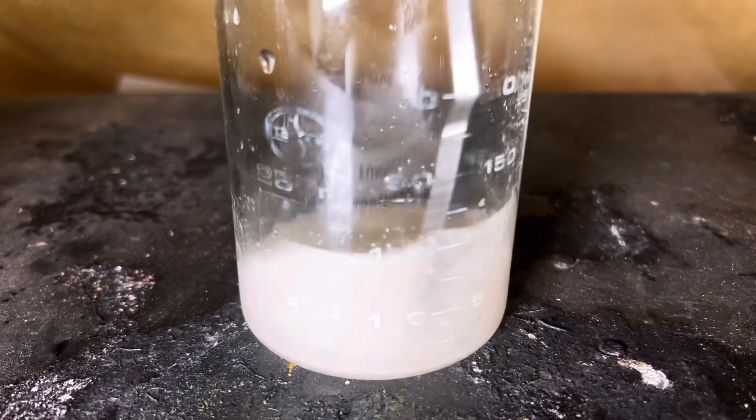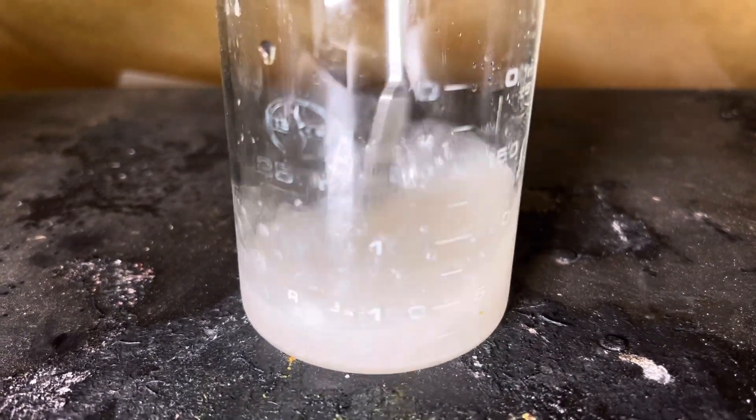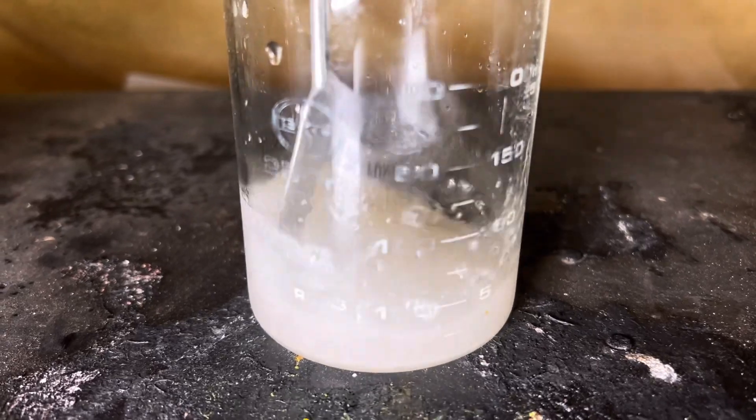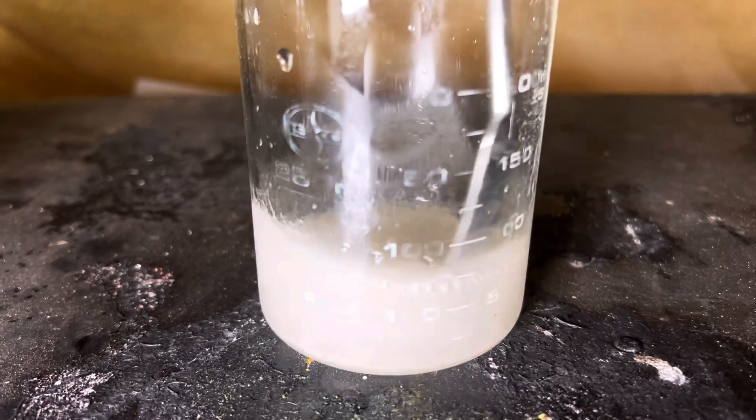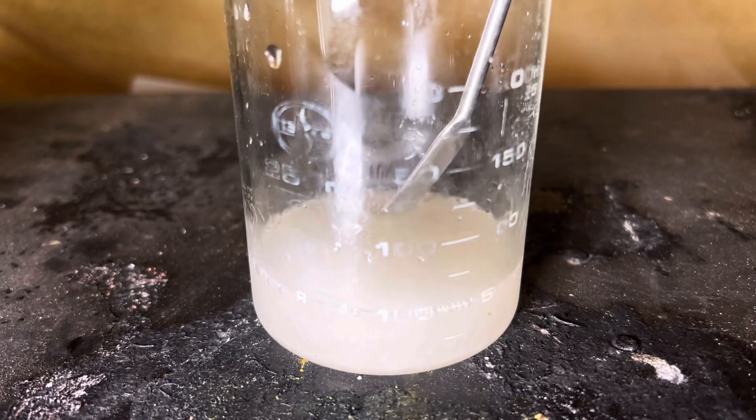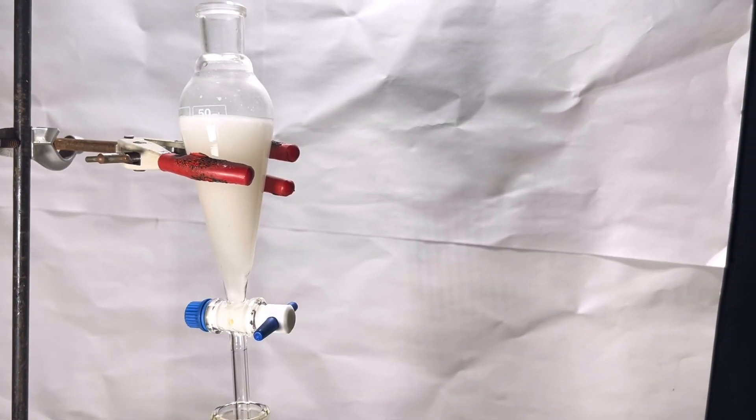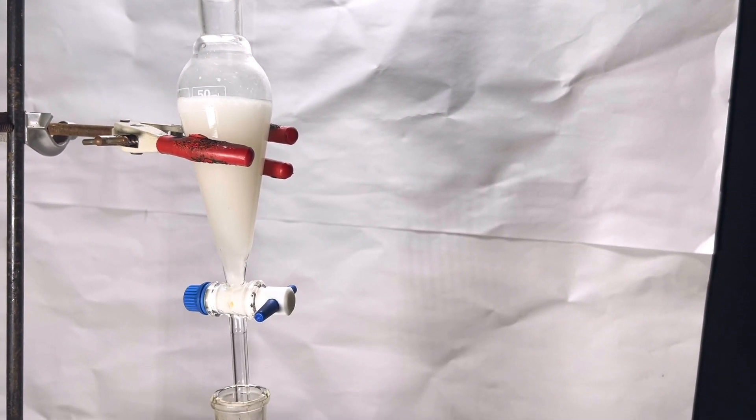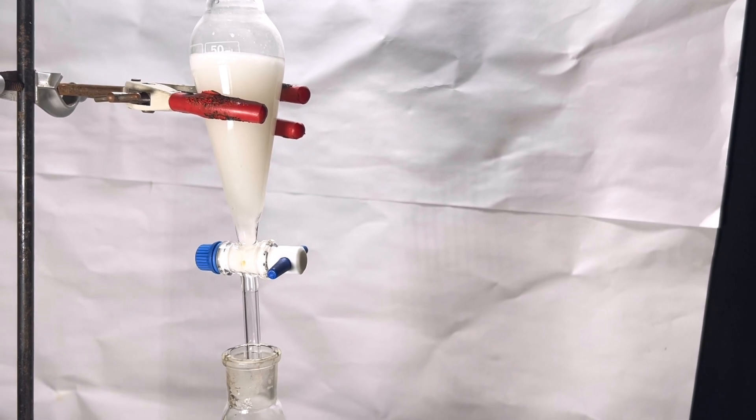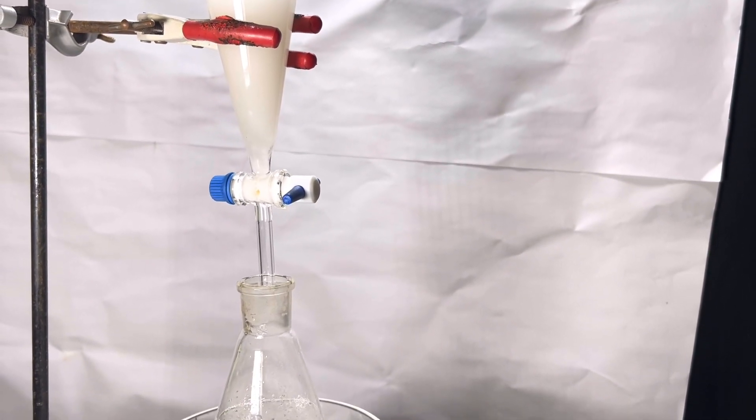Be very careful when handling phenol as it is extremely corrosive and you don't want this concentrated solution splashed on your hands. Then it is equipped in a separatory funnel. It's okay even if the solution doesn't clear up. My preparation went really well even with the milky solution.